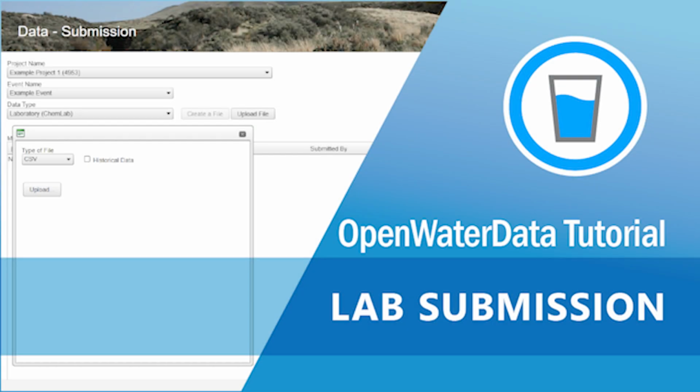This video will go over the basics of submitting laboratory data to the database. After sampling has taken place and data has been analyzed, the lab will submit an electronic data deliverable, or EDD, file and a laboratory report PDF. The database extracts the information from the EDD into data tables that it can use to generate reports. This process depends on the file having the correct structure and using valid values that the database can recognize.